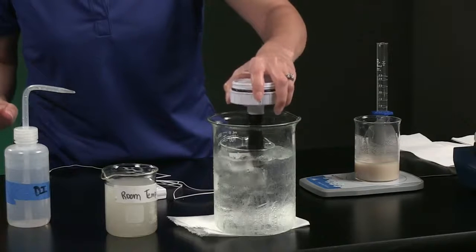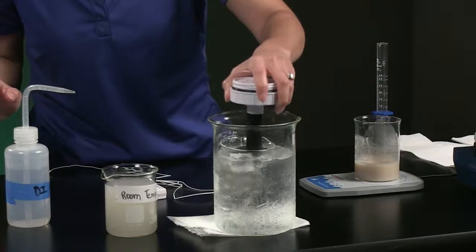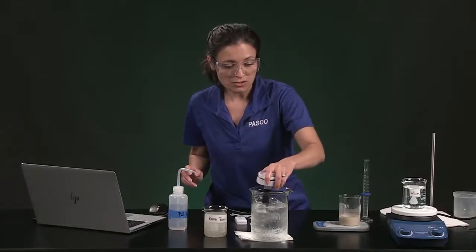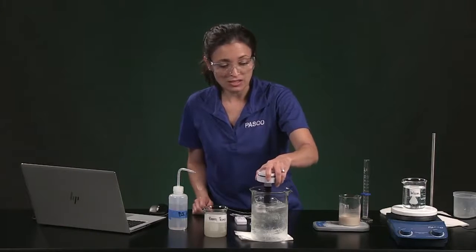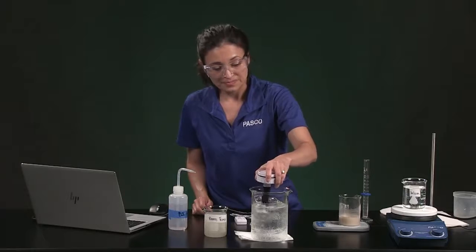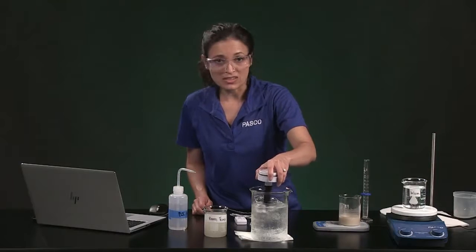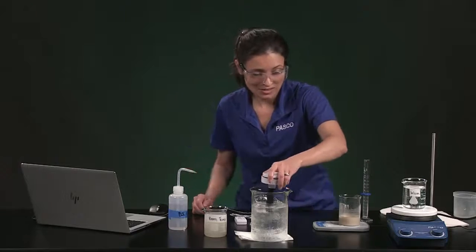Now I'm going to perform the experiment exactly as the first run, and I'm going to speed through data collection for you. So first I need to slowly stir for 30 seconds here. I'm going to add the 15 milliliters of yeast suspension. I'm going to start collecting data. And you need to remember to record the initial dissolved oxygen concentration at the beginning of the run as soon as I start.